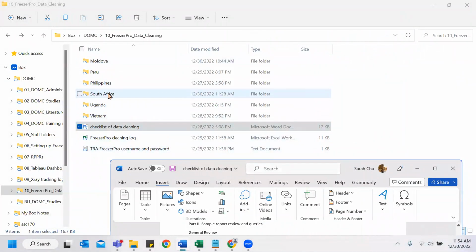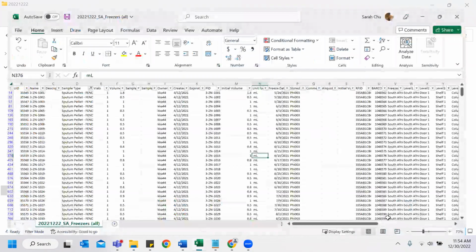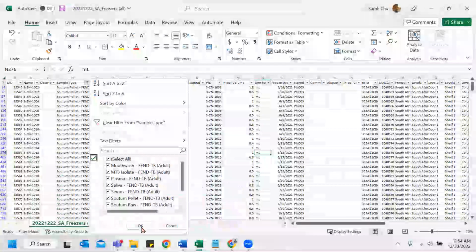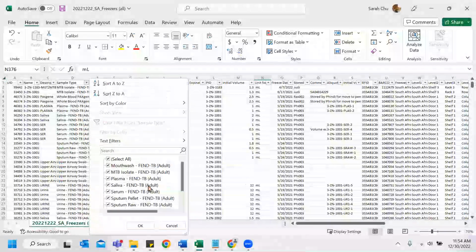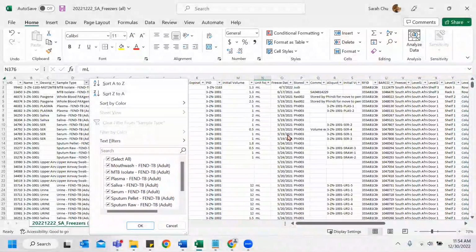So let's do South Africa. Let's do Excel freezers, Excel. Okay, so just an overview of this data set. This is freezers for all samples. So basically it has all the samples in it. Some reports probably have, let's say, 1 or 2 types, but this one includes basically everything.